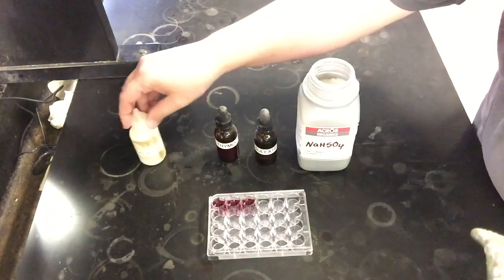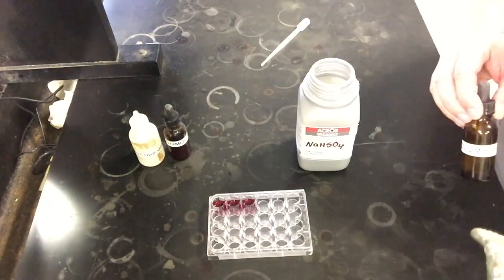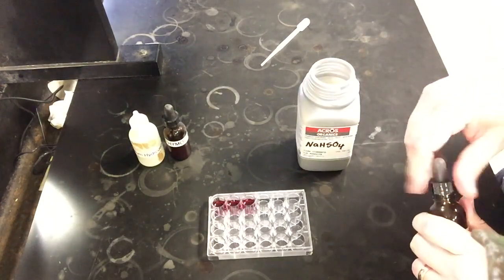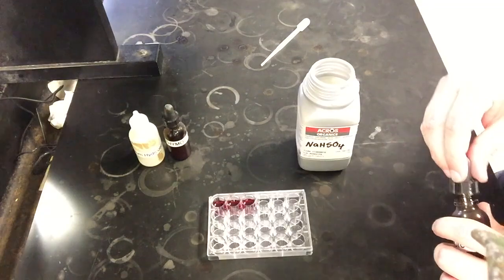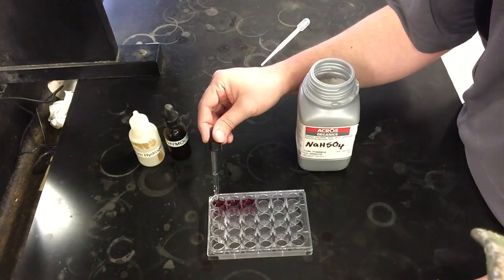So what we're going to do now that I've added our starting reactant and our indicator, I'm going to add some sodium sulfate. Sodium sulfate is on the product side of the dissolution reaction of our starting compound. And so if I add a product, we should expect things to go backwards to the reactant side, which from our pre-lab discussions and assignment, it should be more of a yellowish color, which at the very least should be a lighter color.